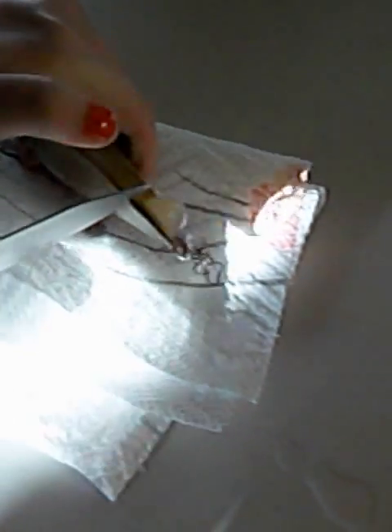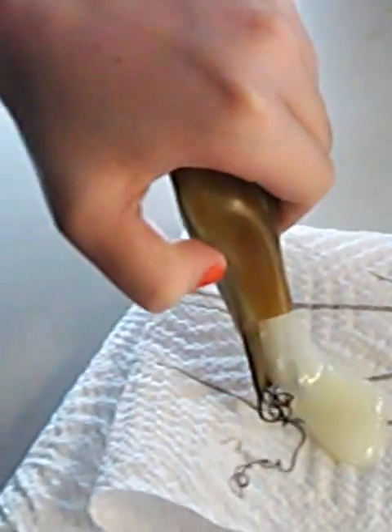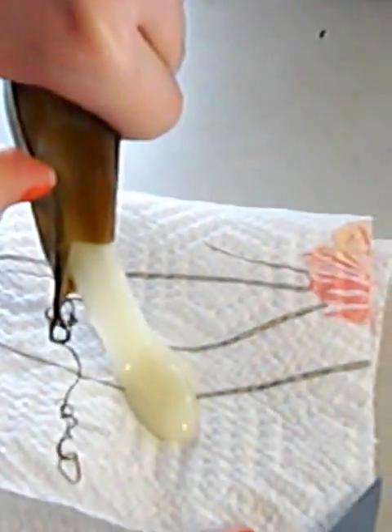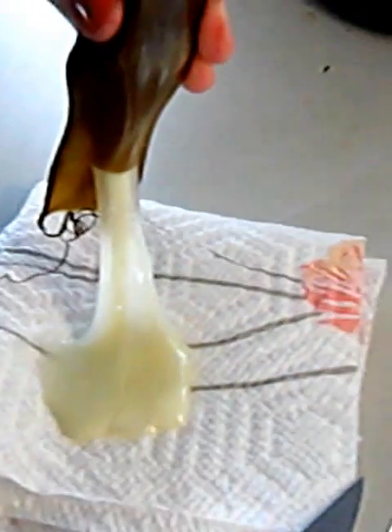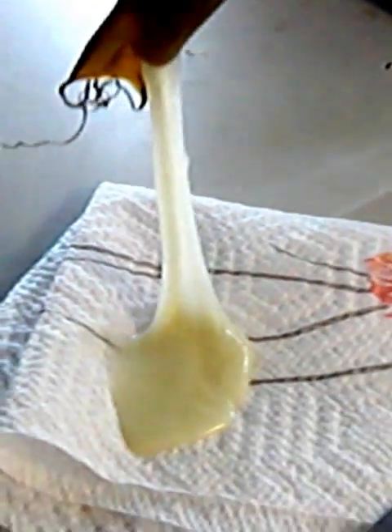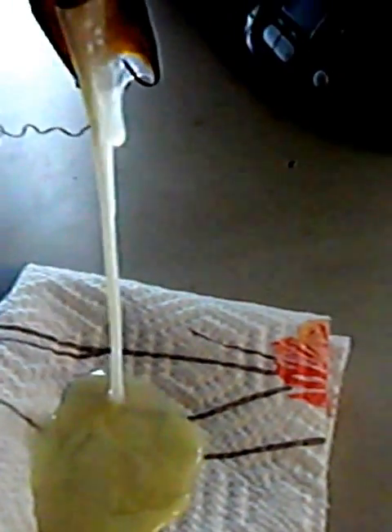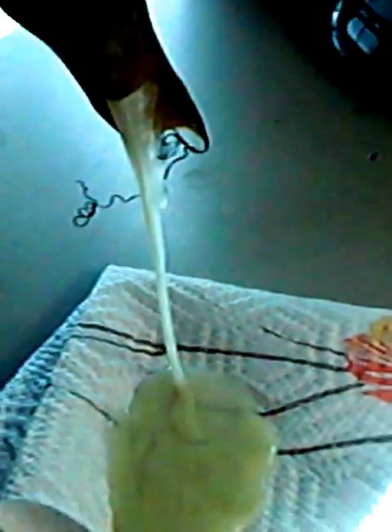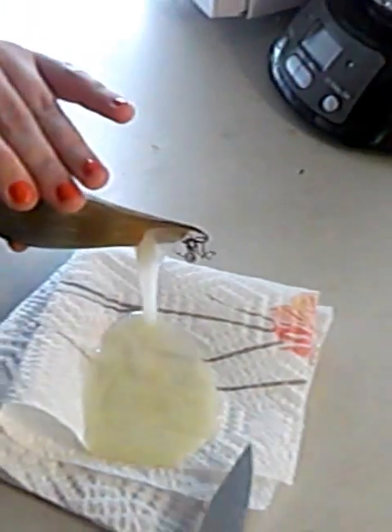Oh my god. It's coming out. Can you just let it hold still? It will not hold still. Oh my god, it's just gonna come out — that's what we're gonna do. Ew. That's just disgusting. That's really gross. Ew, oh god. It looks like milk. Ew. His body's still in there. I want to throw up. It's so gross. This was your choice.